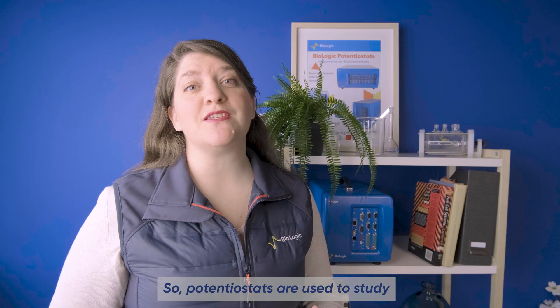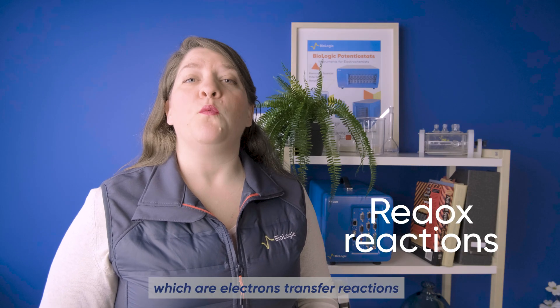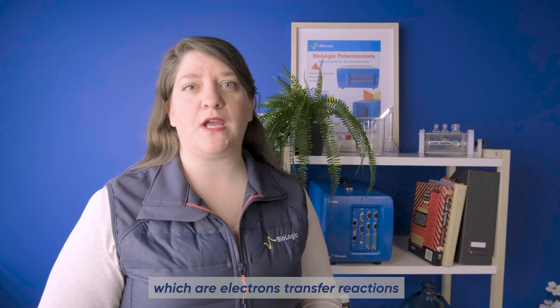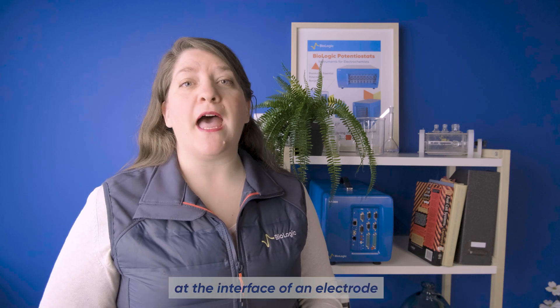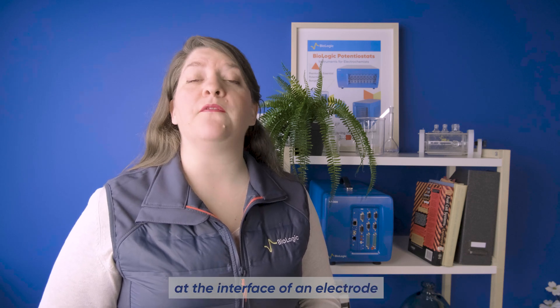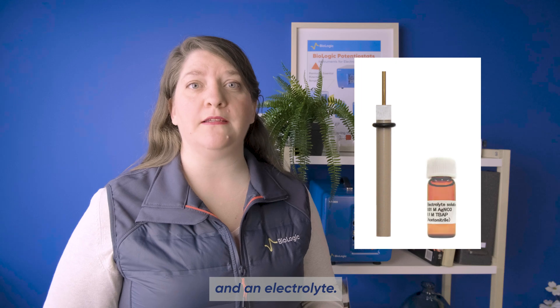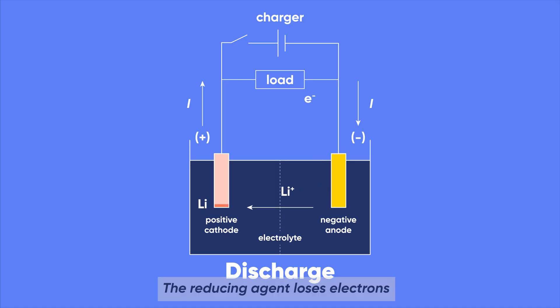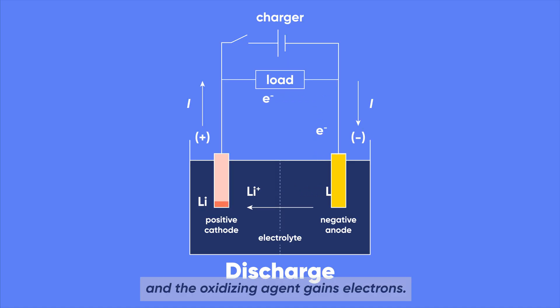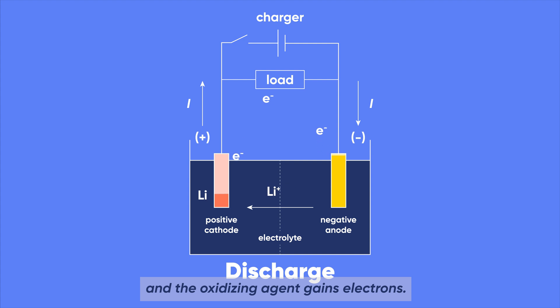Potentiostats are used to study what we call redox reactions, which are electron transfer reactions between substances at the interface of an electrode and an electrolyte. The reducing agent loses electrons and the oxidizing agent gains electrons.